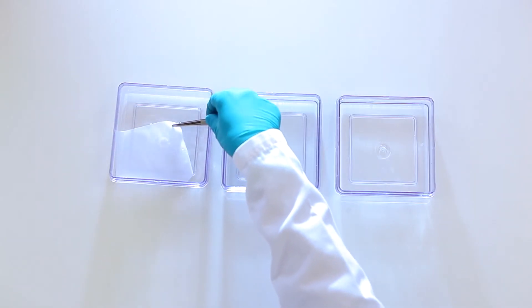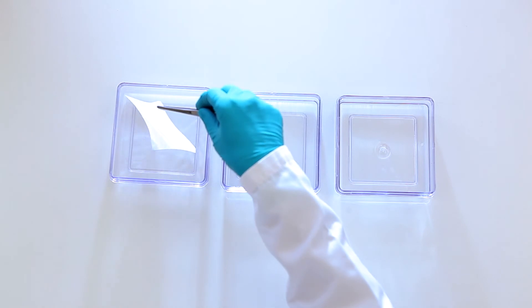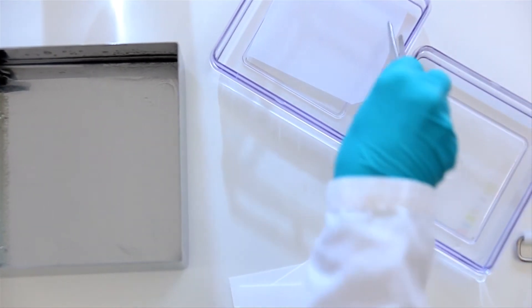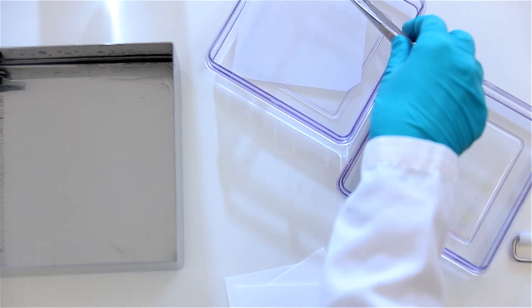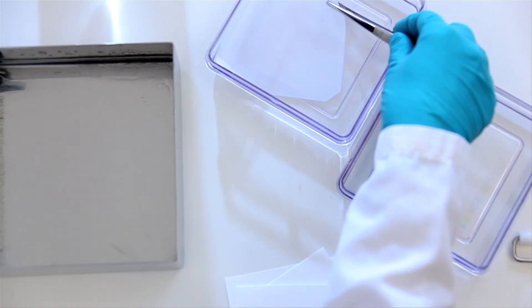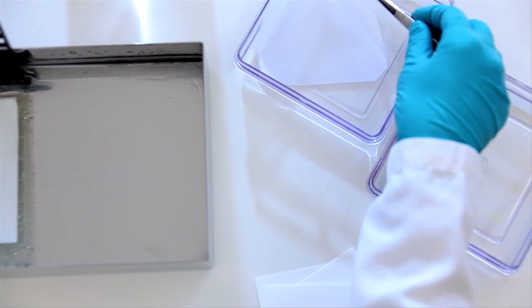You must pre-wet the membrane in methanol. This is true for all PVDF membranes. To avoid errors, always orientate the gel and membrane sandwich with the anode towards you. One corner can be cut off to help with orientation.